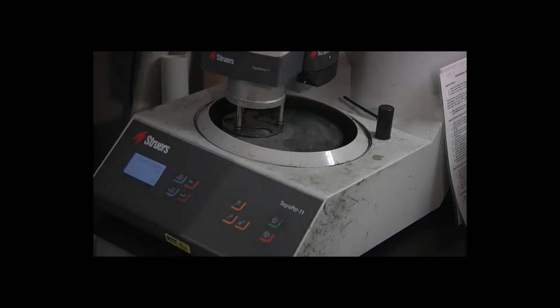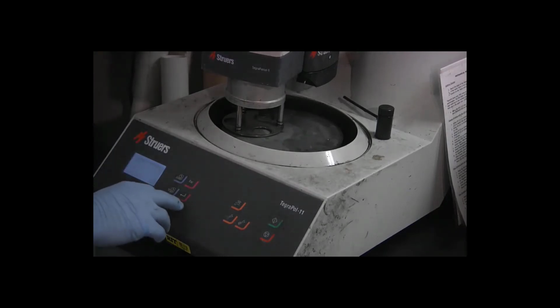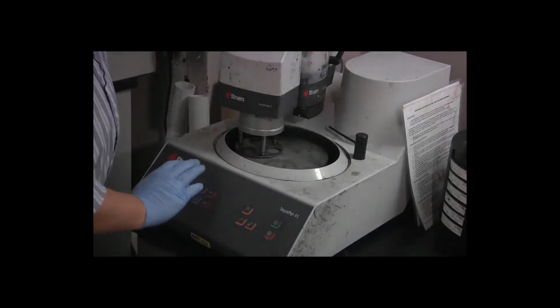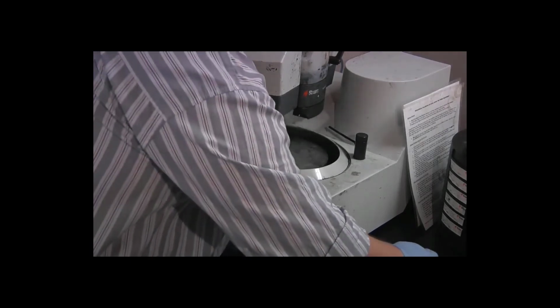So I need to use the arrow keys and the enter key and lower the doser level to 4. The particles are diamond, they don't wear out, but they do slowly get pushed off the edge of the disc. If we put too much on there, it will just increase the speed that it gets pushed off the end of the disc, and that's why a level of 10 is too much. By trial and error, we've figured out that a level of 4 is pretty much adequate. So I press enter to lock in that setting. Specimen bottles installed, settings fixed.